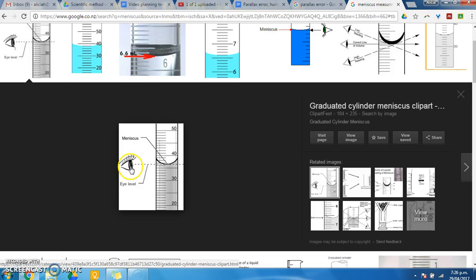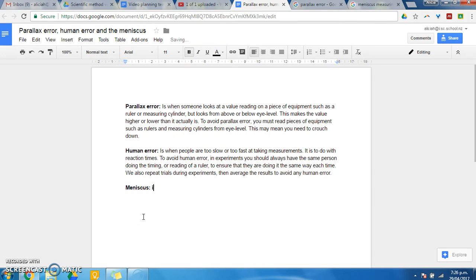This person is looking from eye level to avoid parallax error at the base of the meniscus, which is this lowest point here. If we have a look on this measuring cylinder, that's 30 there, so that's 35. That means that this is probably 36.5 or thereabouts at the base of the meniscus. So, back to our notes, meniscus is the lowest point of the liquid when measuring that liquid. That's where you must measure from. Alright, hopefully those words have helped. These are the things to consider when you're talking about how you keep your results accurate and reliable.